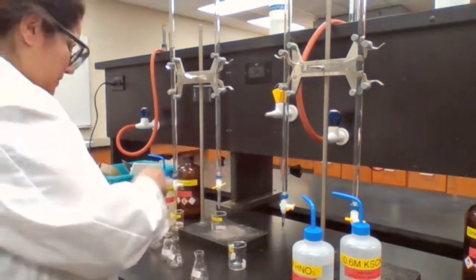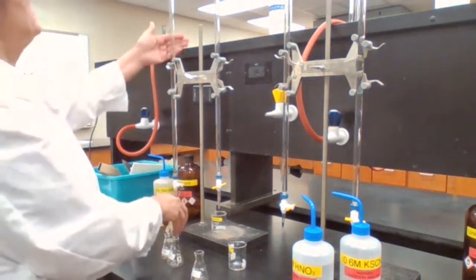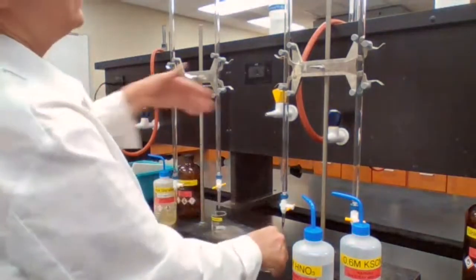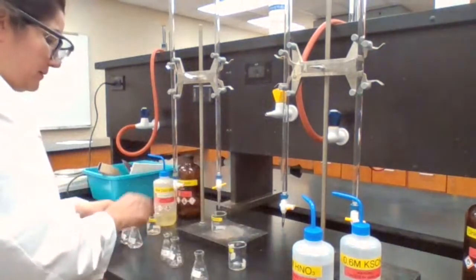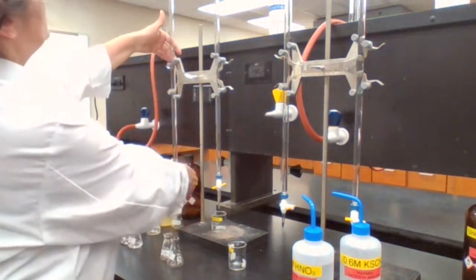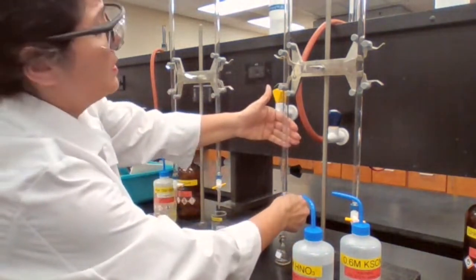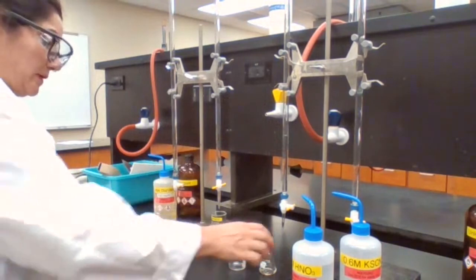Solution A is prepared. For flask B: one milliliter of iron solution, so I'm adding one milliliter of iron, and four milliliters of nitric acid — going from 34 to 38. KSCN is added later. A and B are ready. For flask C: two milliliters of iron, going from 19 to 21, and three milliliters of nitric acid, going from 38 to 41. Flask C is ready.